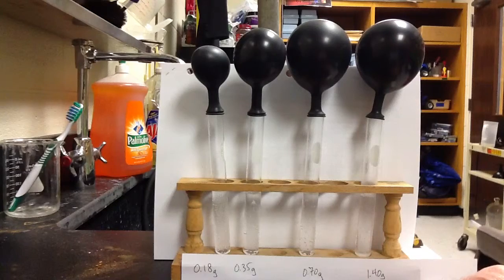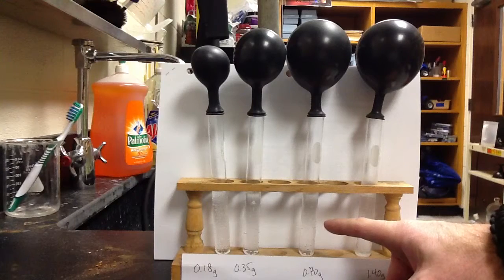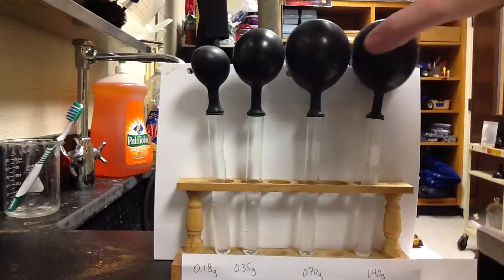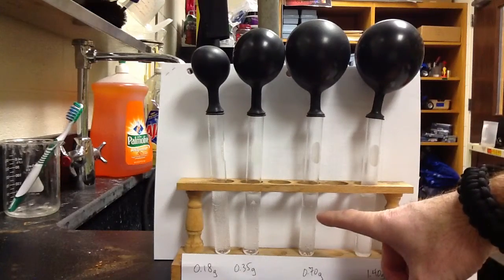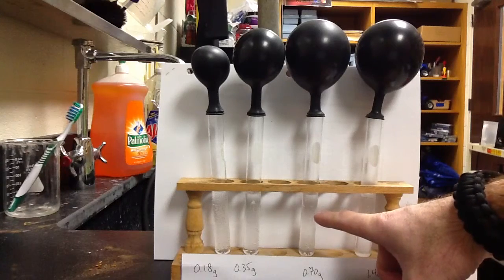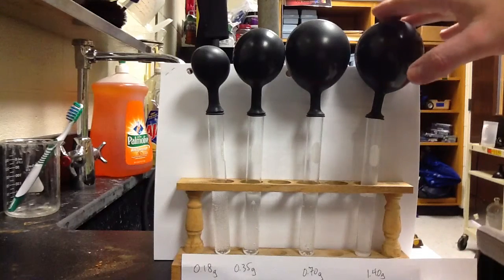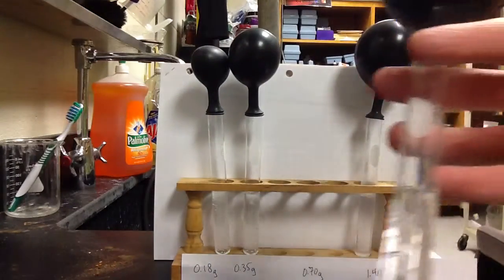So we have excess vinegar in test tube 1 and 2, and what about test tube 3? Well, if there's unreacted vinegar in here, then when we add more baking soda, you'll produce more gas. Well, that's what we've done in test tube 4, and we did not produce any more gas from test tube 3 to 4. So that tells me there's not any unreacted vinegar. There's no excess vinegar here, because when you added more baking soda, as we did, you don't produce any more gas. So in test tube 3, we don't see any baking soda in here.